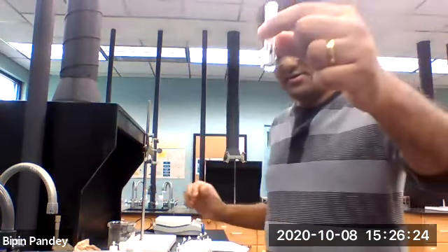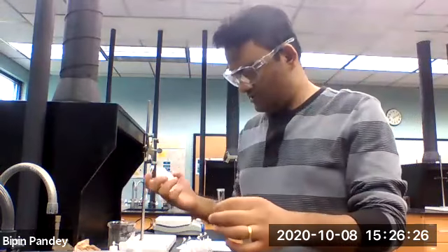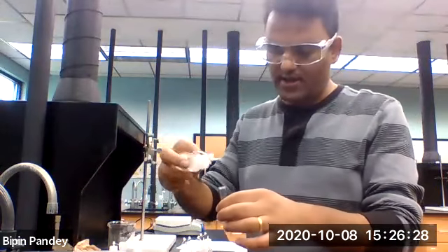So I have copper solution. I'm adding sodium iodide.